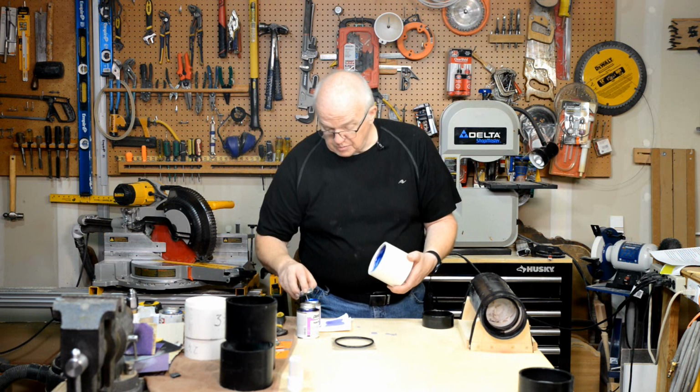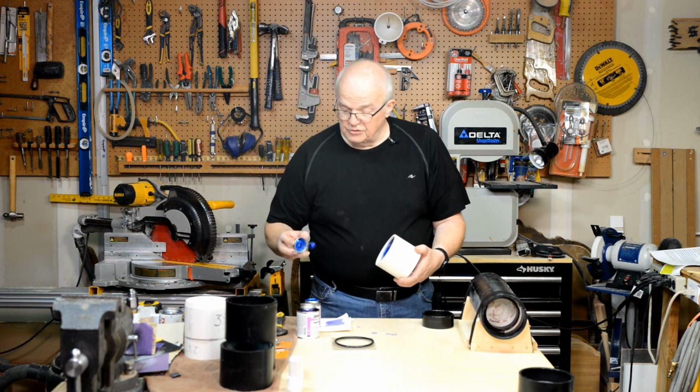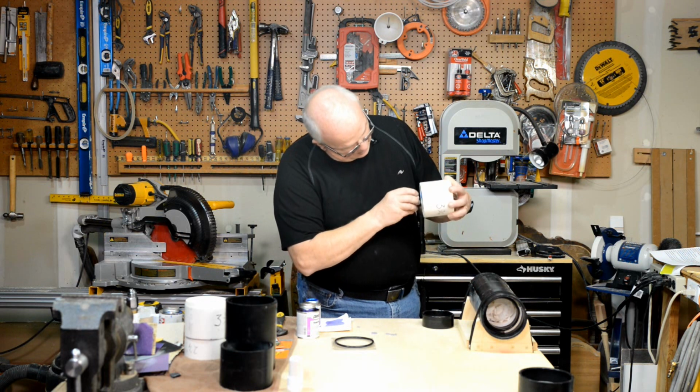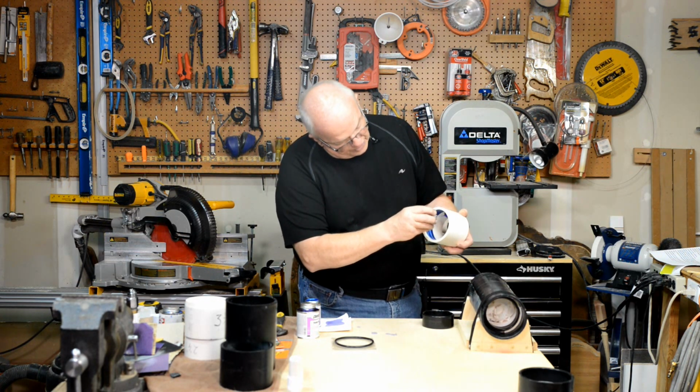Now, because like I said before, I want to have squeeze out on this. Make sure it's not dripping. I put it inside of there, and I put, like I say, a very liberal amount of the glue or the cement and adhesive inside of here.